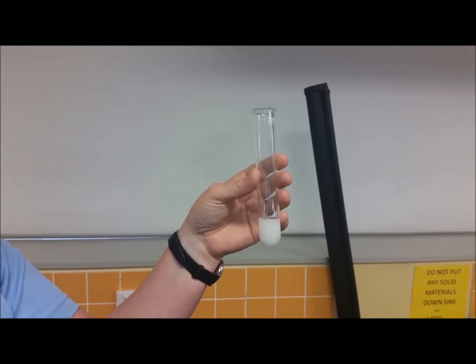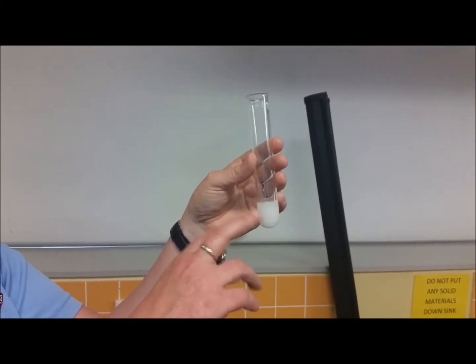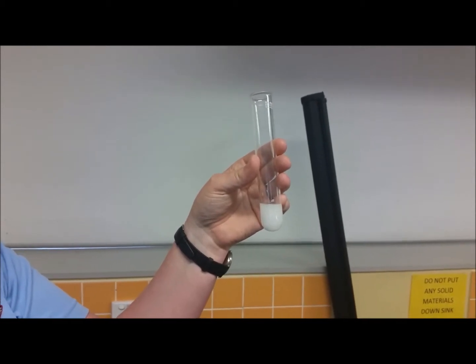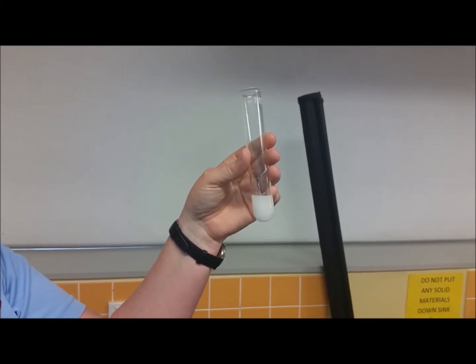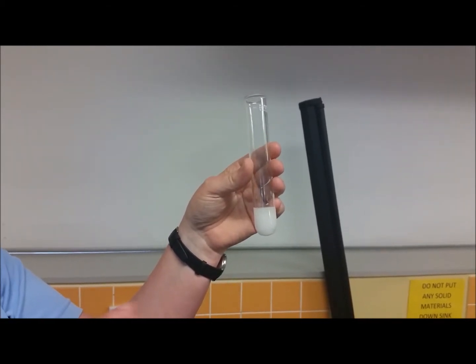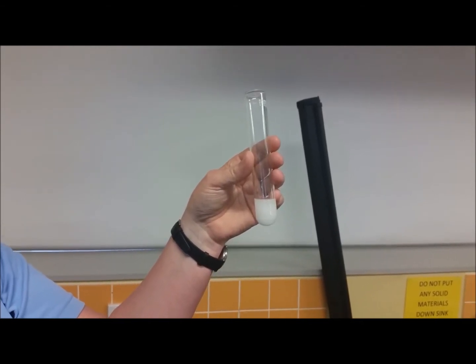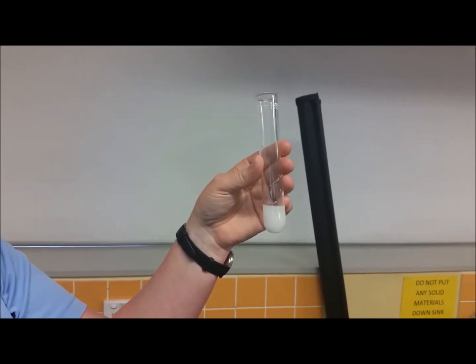And the same as the previous two tests that we've done, I know that I have starch solution in the bottom of this test tube. I'm going to add my reagent to it, so whatever change we actually see is the positive test result for starch.